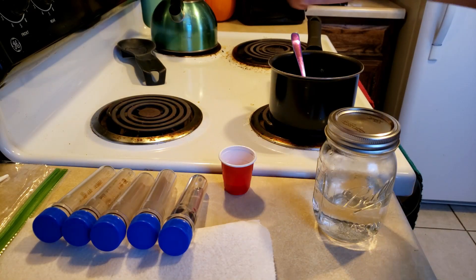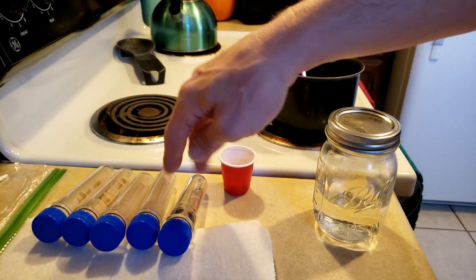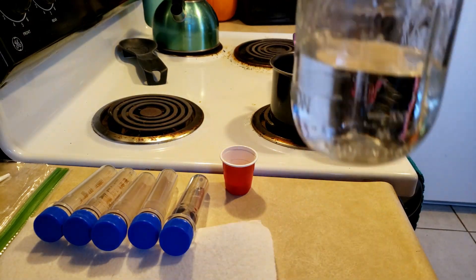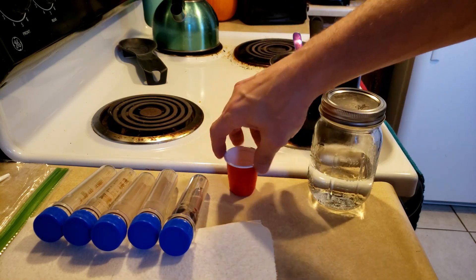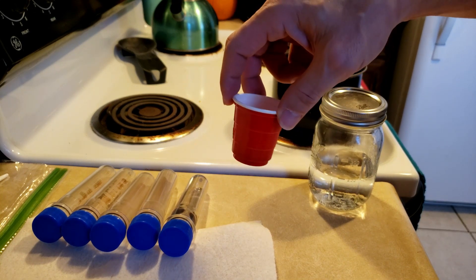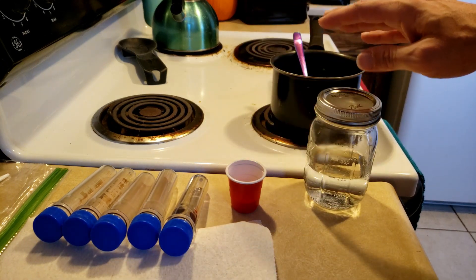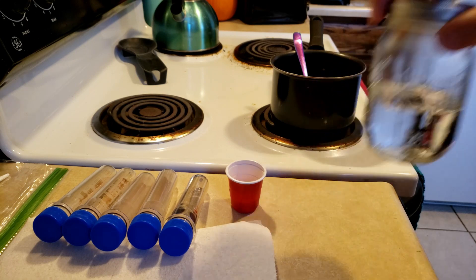Alright, we're back and our sticks have been done boiling. I've drained them, put them into the tubes, and washed the pot. Also, I was doing a little math and I'm going to do 200 milliliters of water. So I went ahead and re-measured and got another 5 grams of powdered mix so that we can use that — 10 total grams and 200 milliliters of water.